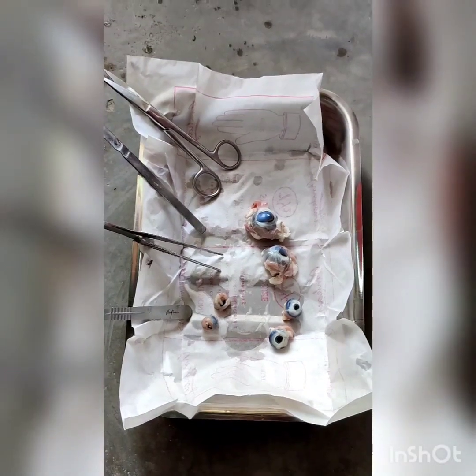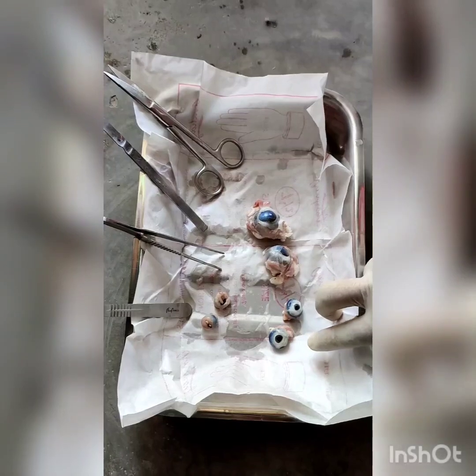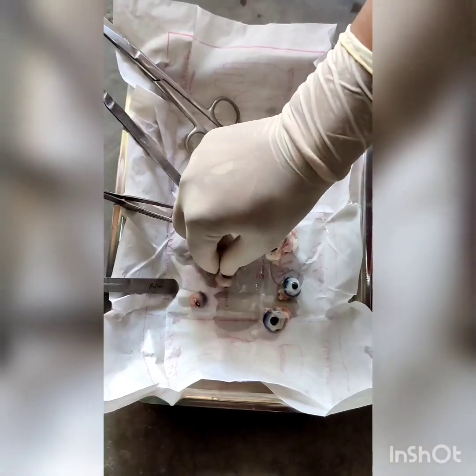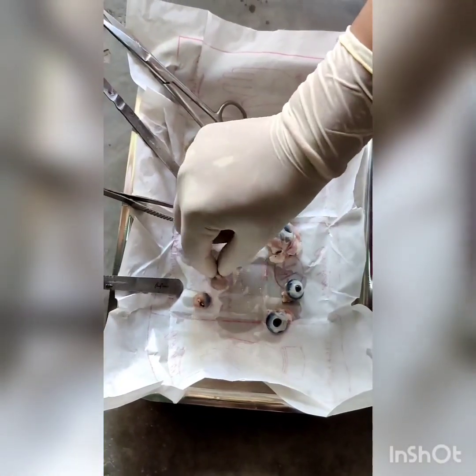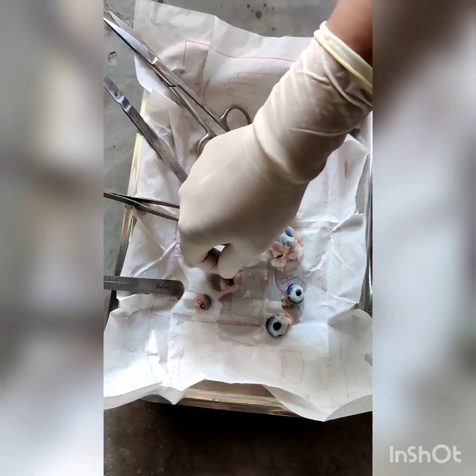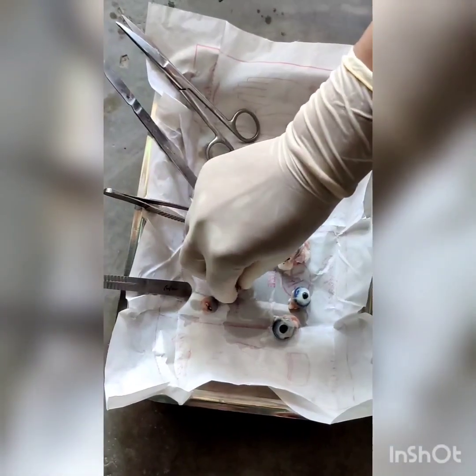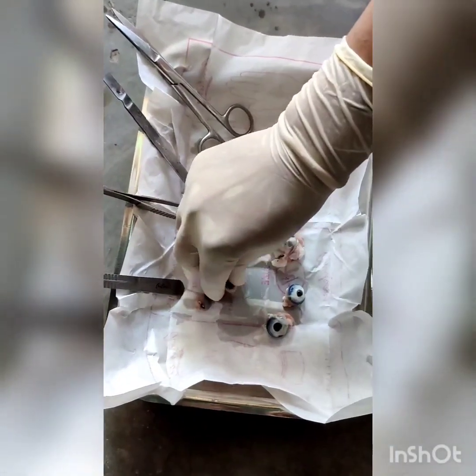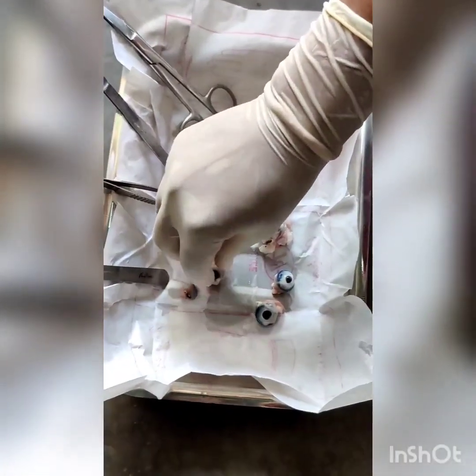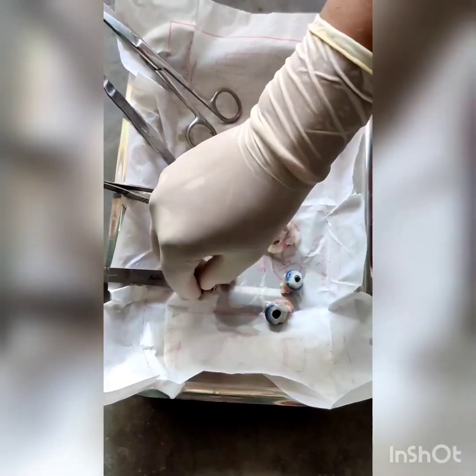Here we have two eyes of the goat, and these two eyes are of chicken, and the smaller ones are of the fish. The fish name is unknown but they are noticeably smaller eyes.